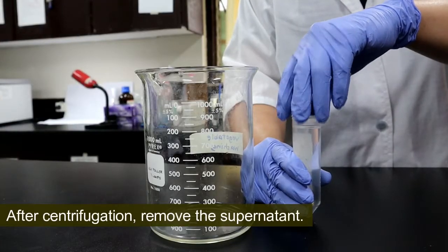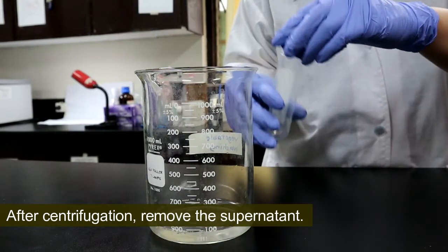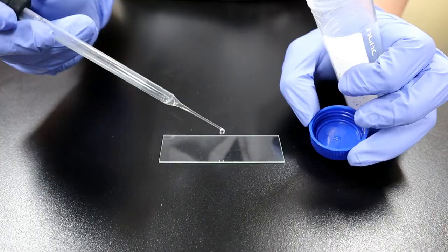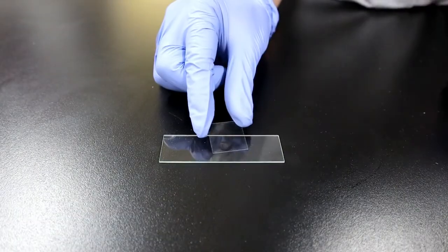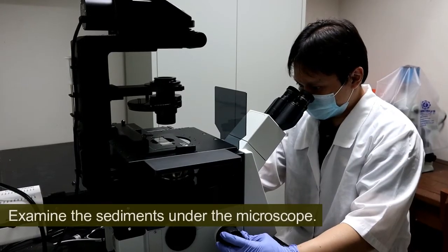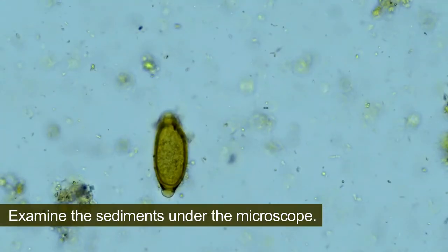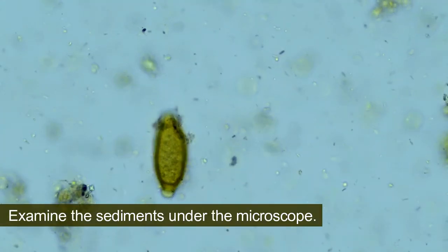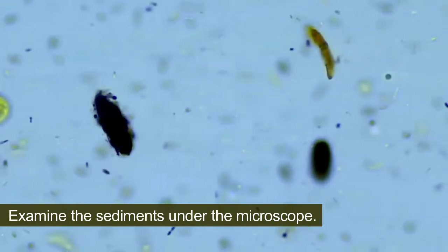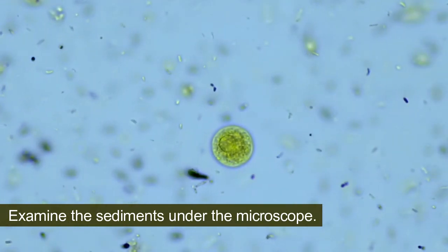Transfer the sediments into test tubes and centrifuge for 10 minutes at 3,000 RPM. After centrifugation, remove the supernatant. Examine the sediments under the microscope for the presence of parasite eggs, protozoan oocysts, and trophozoites under light microscope.